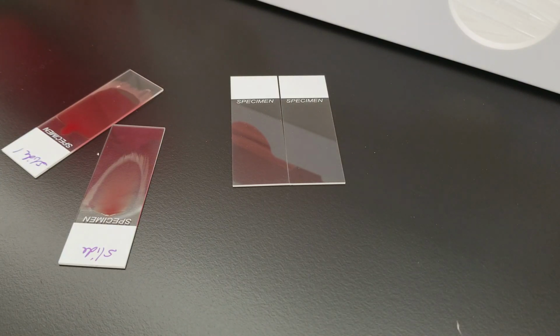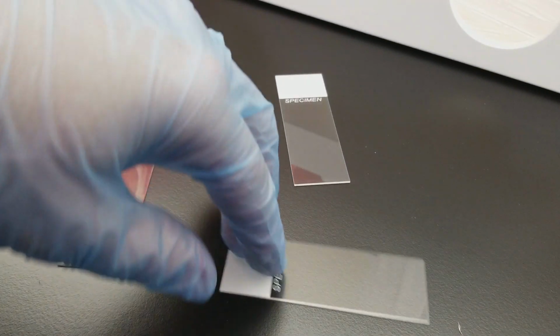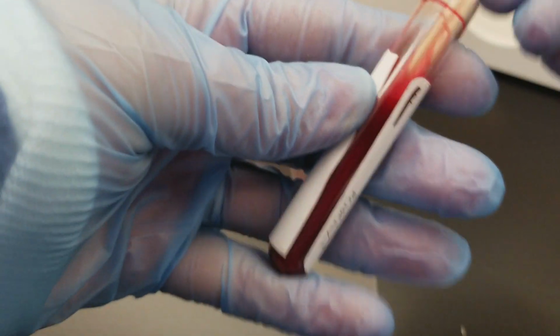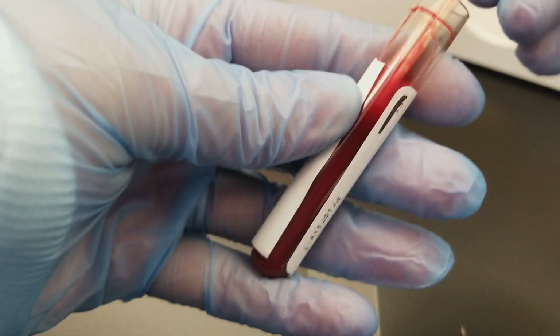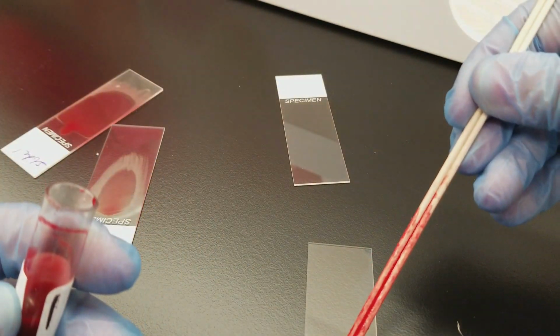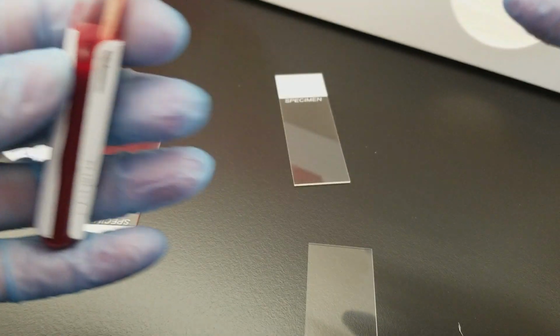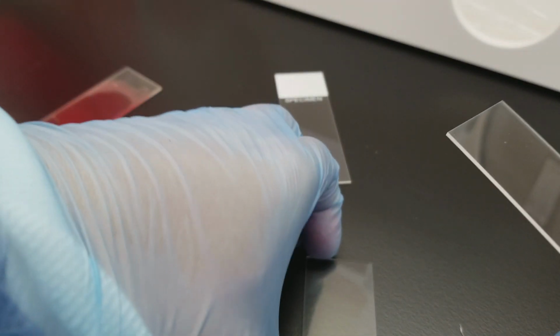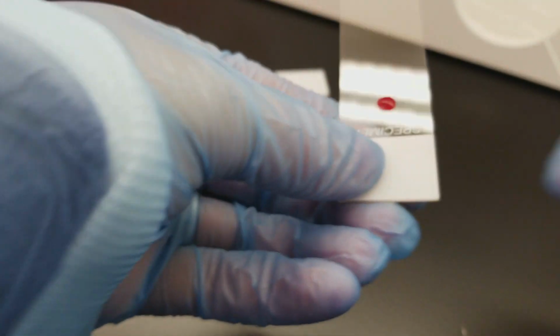But I think that's pretty darn good for a video. It's very hard to do it on video and it's a little nerve-wracking. We'll try one more so you can see this again. Like I said, it was really cool. This person was using sticks. I had never seen anybody use sticks before instead of using a dropper. Oh, that one's probably too big too. Everything that I'm doing wrong is on video. It's so great.